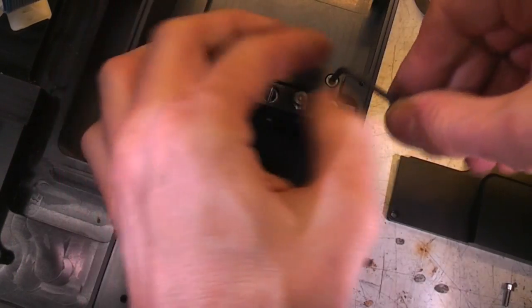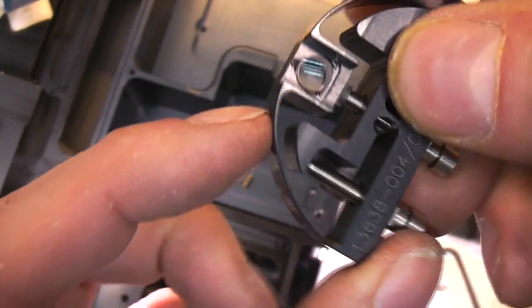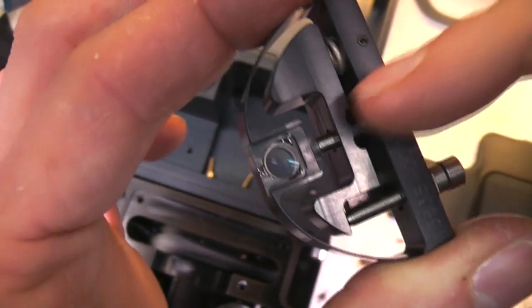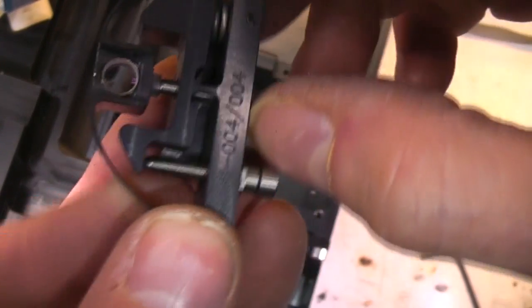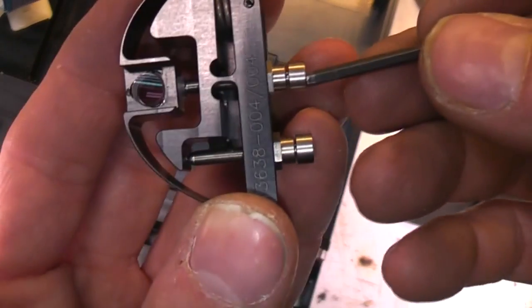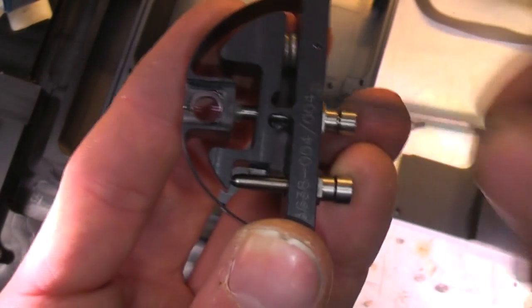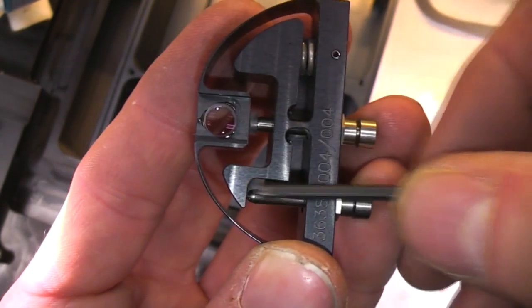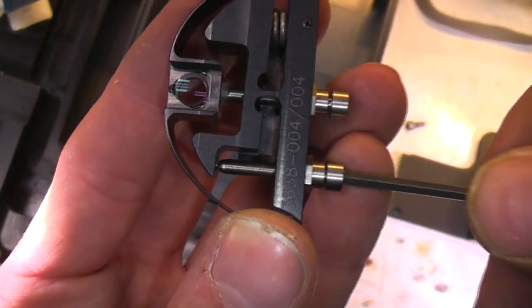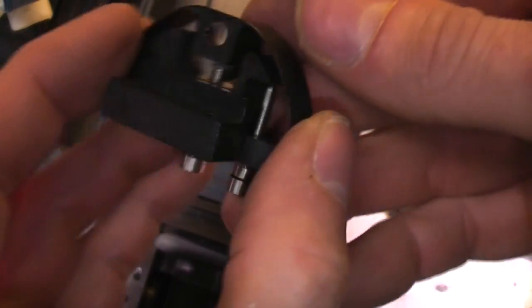And there's a piece here, it looks like it's just a fixed lens or something. There's a lens there, but there's also an adjustment, so it looks like you've got a solid piece of aluminium that's acting as a spring, and then there's actually another spring here, and a couple of adjustment screws. So this screw pushes it that way, and this adjustment screw levers it so that moving that screw will adjust it that way. So that's obviously a very fine adjustment of lens position in the beam path.